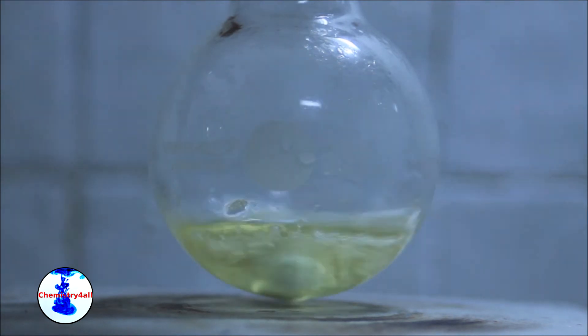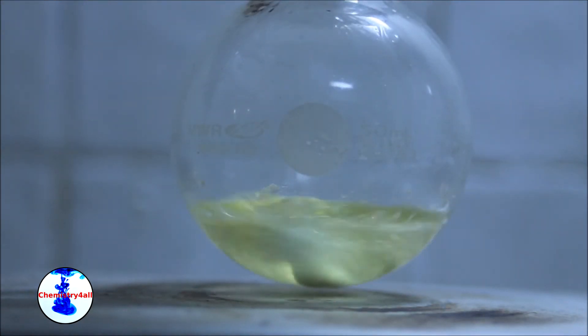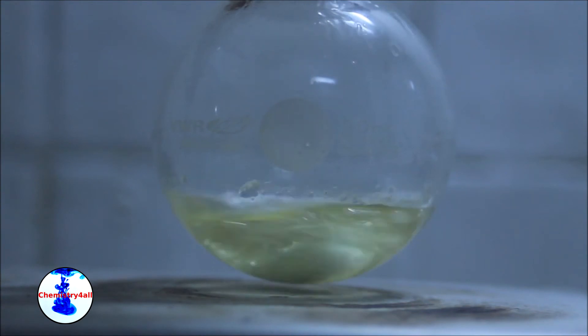You can clearly see how the system starts to reflux after a while. The system is left under reflux for about an hour. Ideally we should check that the reaction has really finished by running a TLC, however I ran out of TLC plates, so I could not check it.